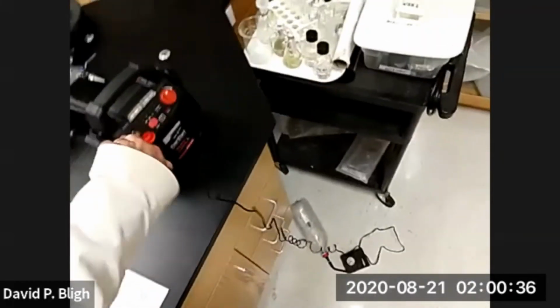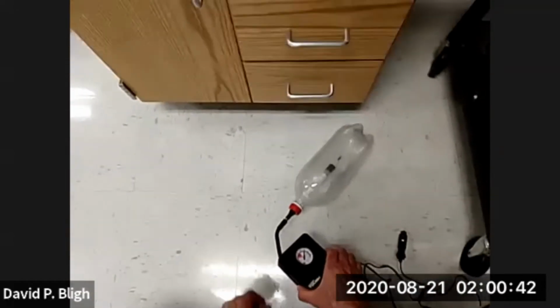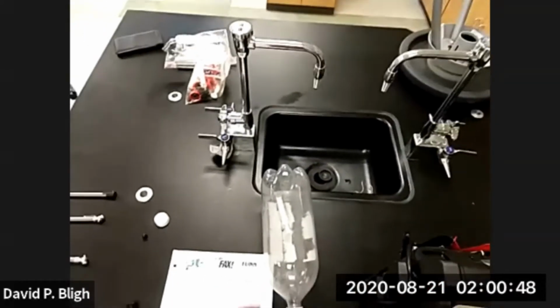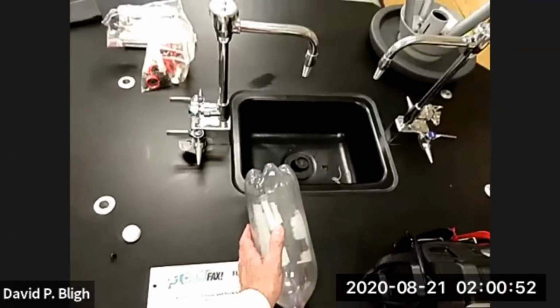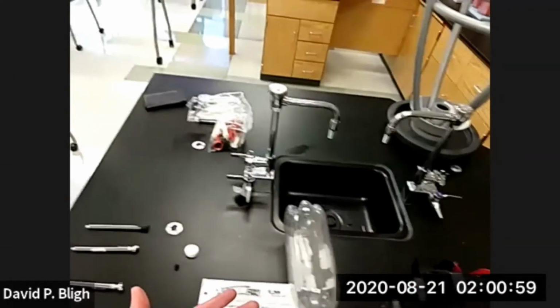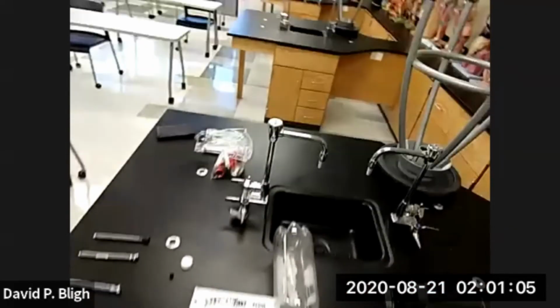Okay, that's enough pressure. We're up to about 60 pounds. Now this gauge is rough, right? We need a tire gauge to give us an exact measure. And if you were here in person, you could see the condensation in there, but there's a lot of heat as well. So we need to let it sit for just a few minutes so the temperature will equilibrate. So as we check the pressure, the temperature remains as near constant as possible.